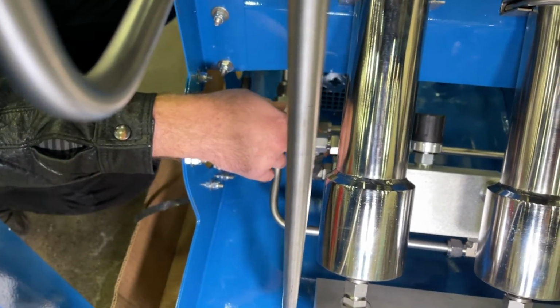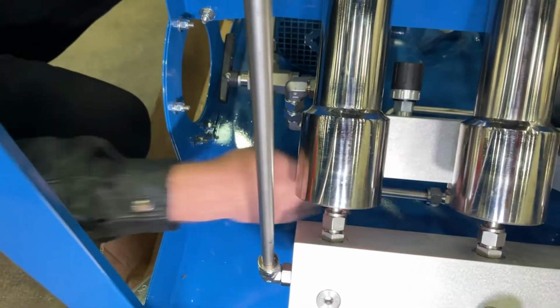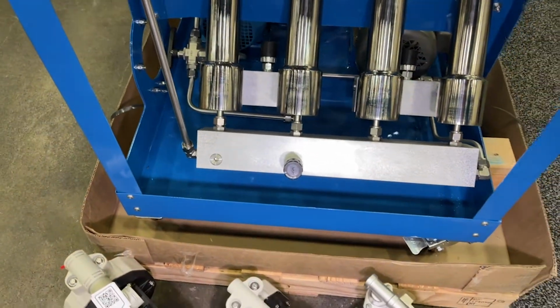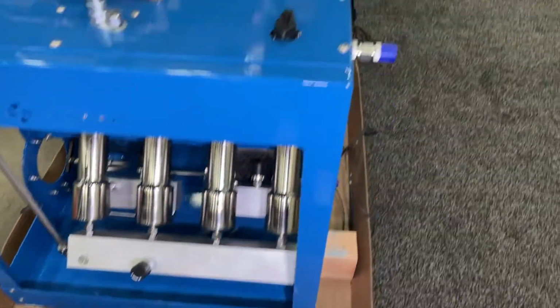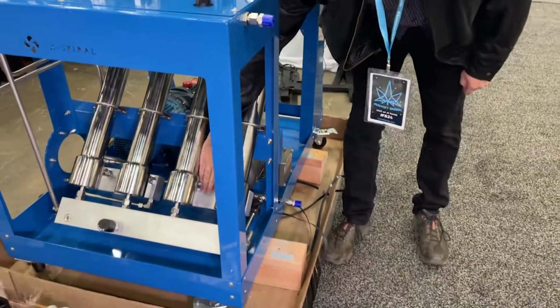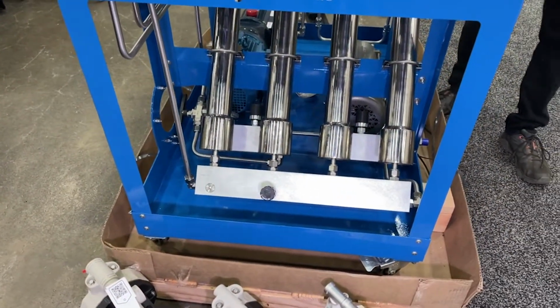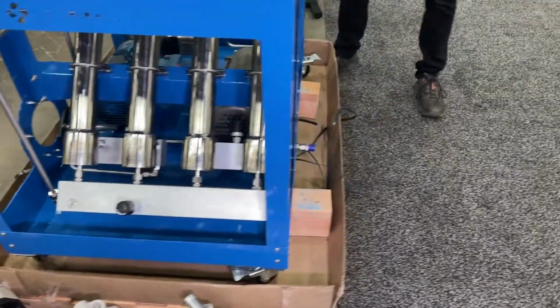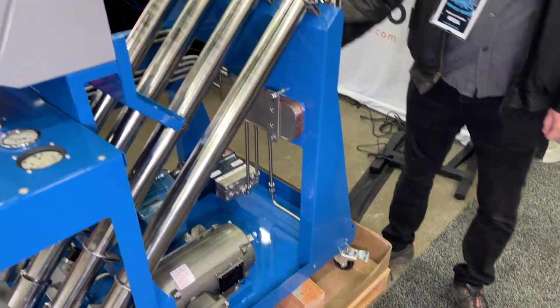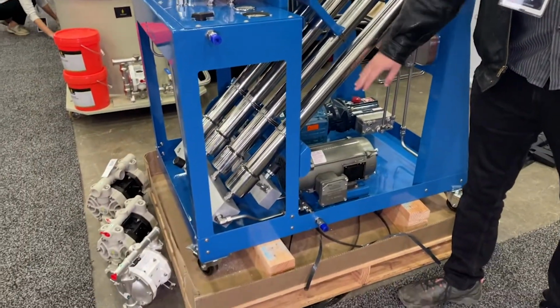If it goes through the next three housings, the fluid will then be passed through this block manifold to the second housing, come up, move around to the third housing, come back down, move around to the fourth housing, come back up, and then return back to the fluid manifold, where it will then be passed back to the loop pump to be set for further loops.